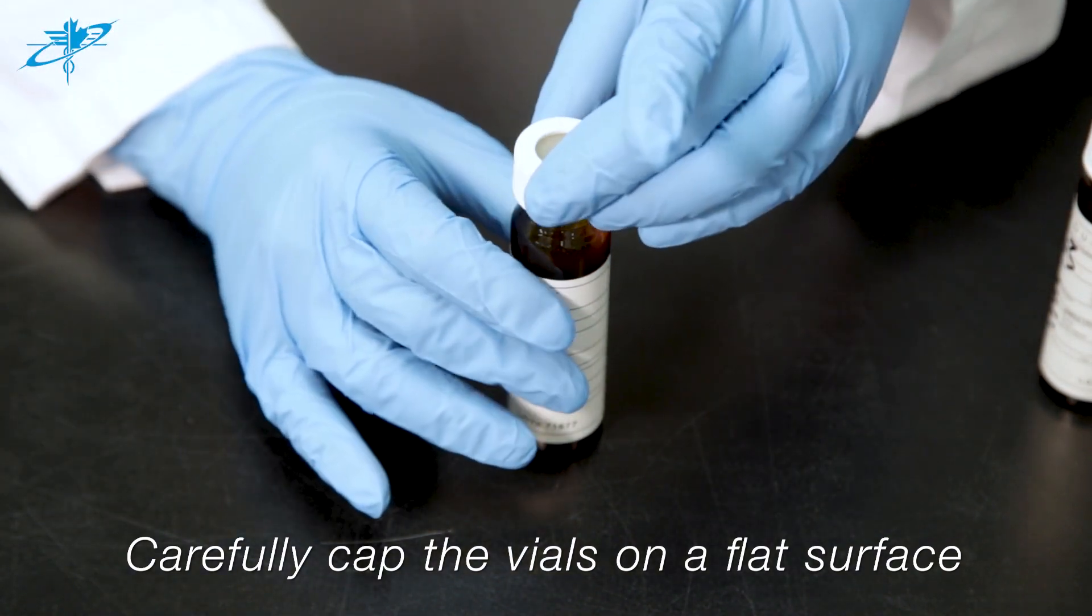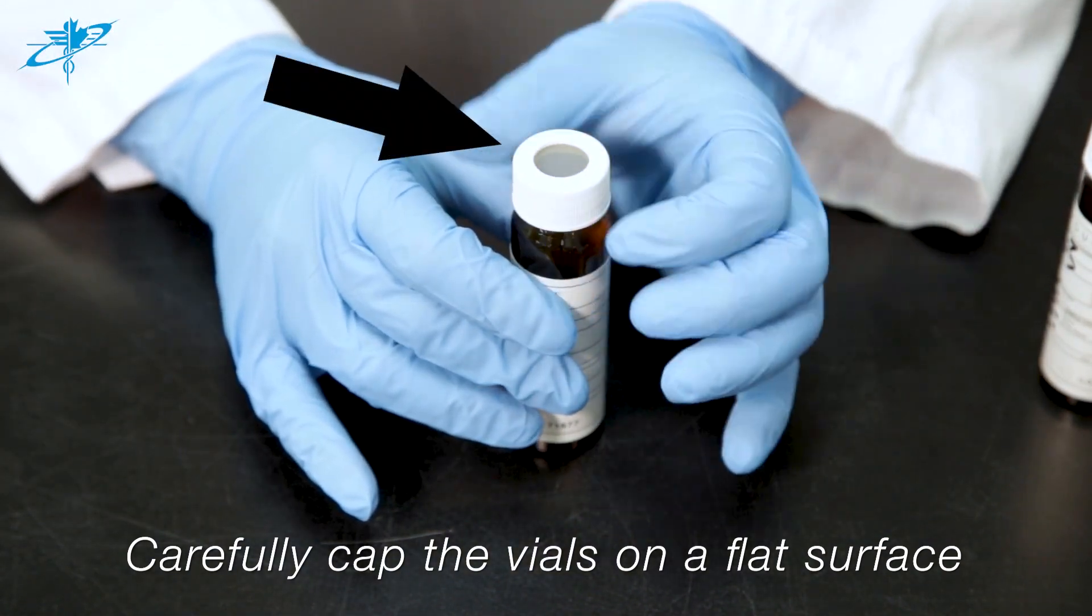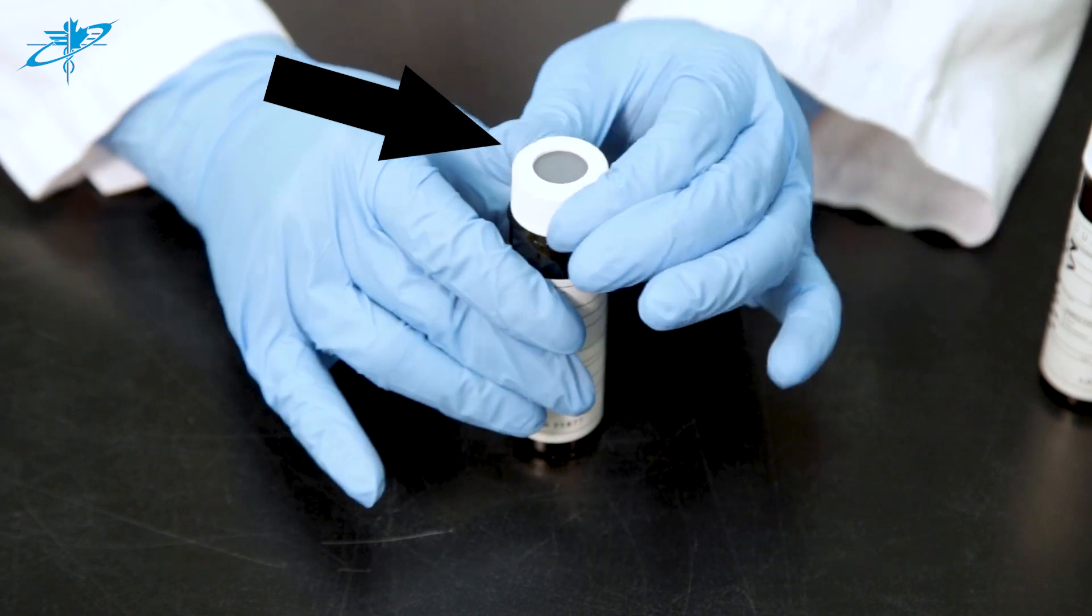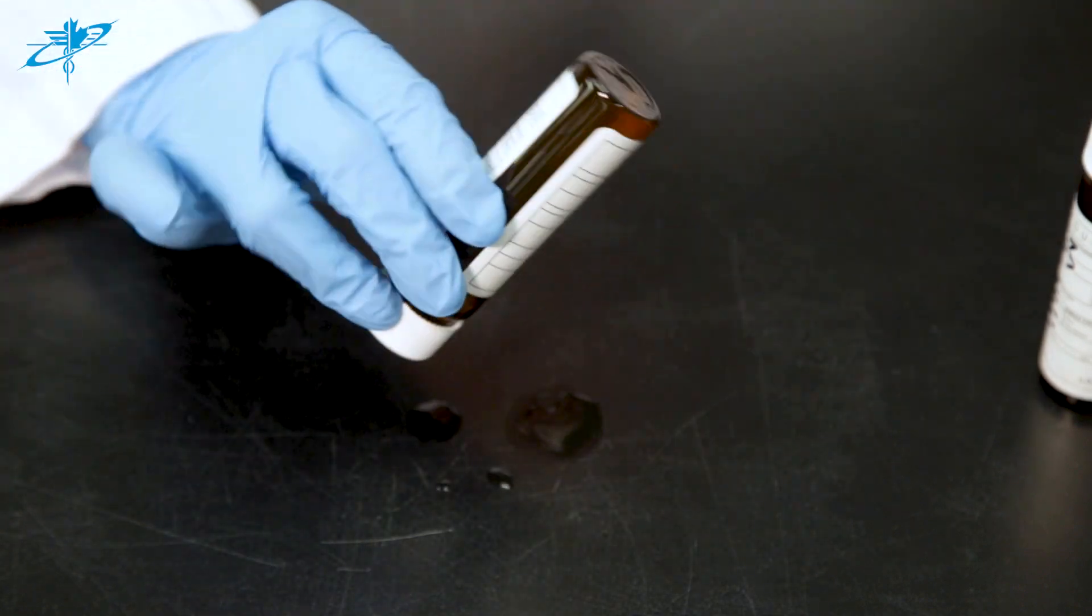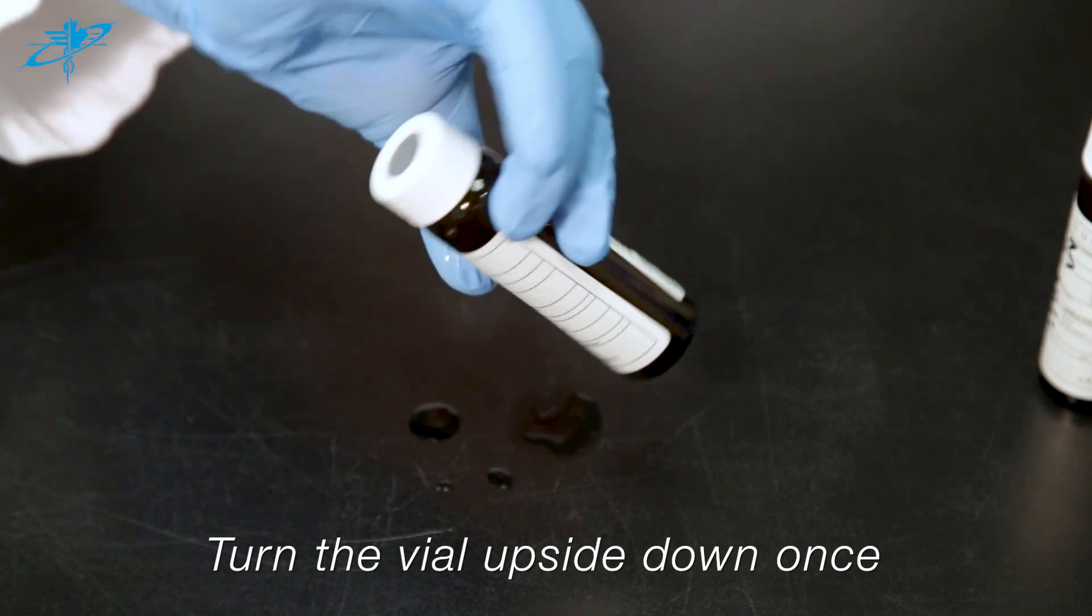Verify that the septum seal on the cap is not protruding out. Turn the vial upside down to ensure that there are no air bubbles present.